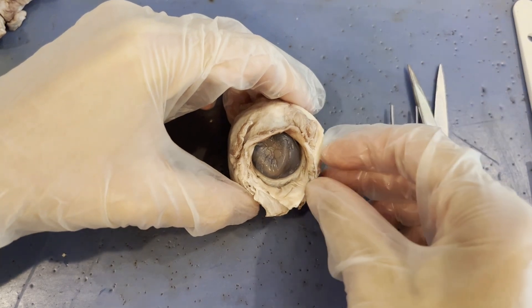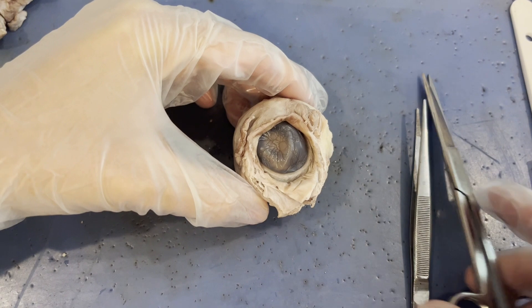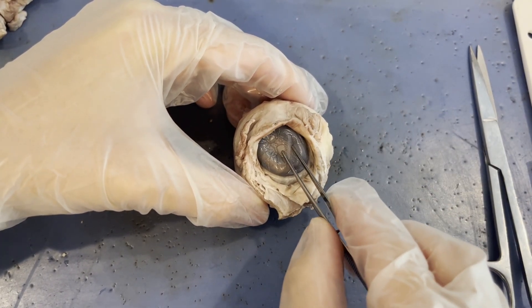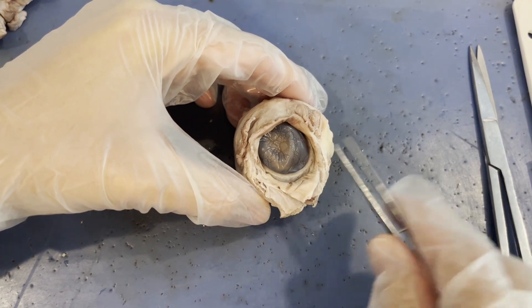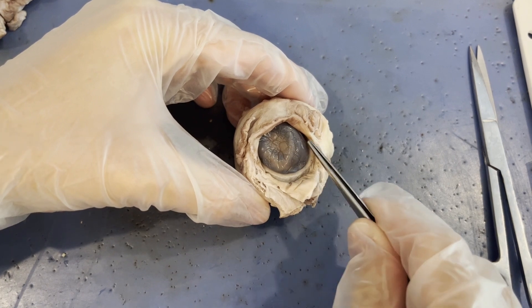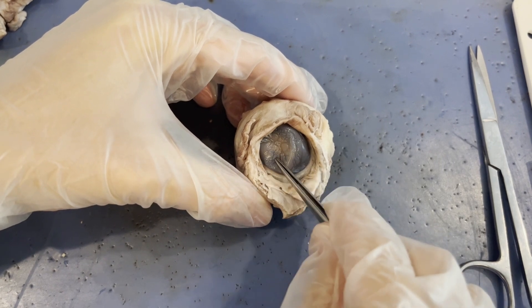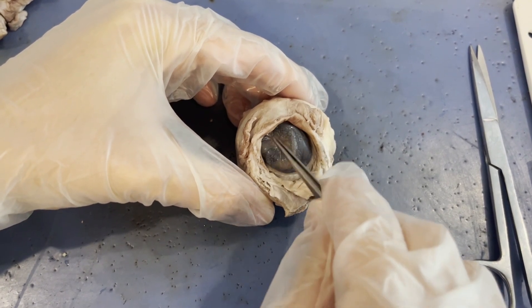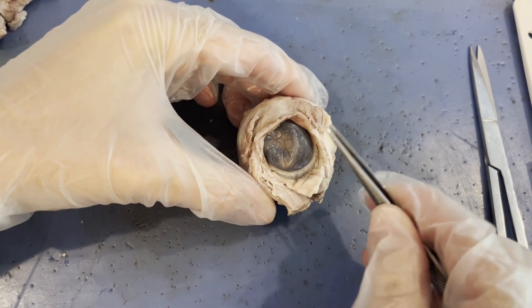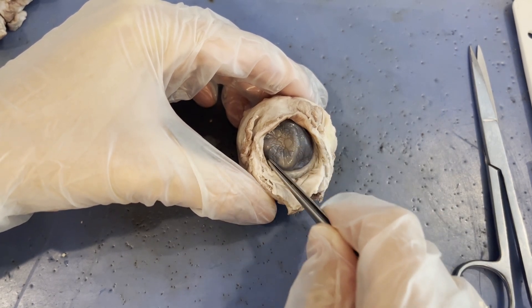When the cow was alive, the cornea was much more clear, but because this eye has been preserved, preservation changes the color of the cornea so it has a more cloudy appearance now. The reason it needs to be clear or transparent is that this is what all of the light entering your eye comes through. The cornea has two jobs. The first is that it is pretty tough — I can push on it and there's really no risk of my forceps popping through it. This membrane protects the eye from dust, dirt, and pathogens.